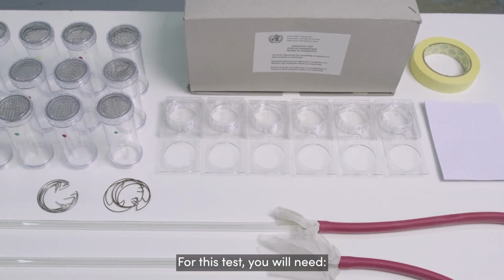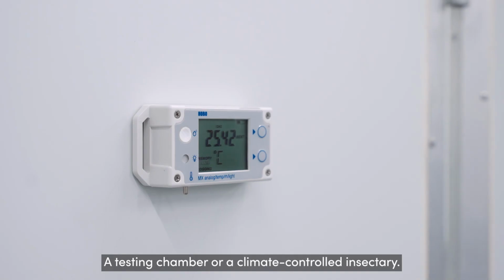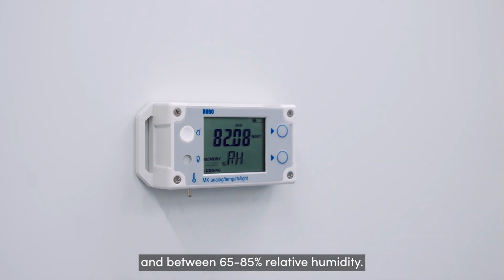For this test, you will need a testing chamber or a climate-controlled insectary at about 25 to 29 degrees Celsius and between 65 to 85% relative humidity.